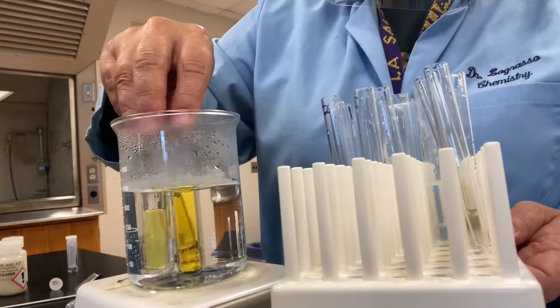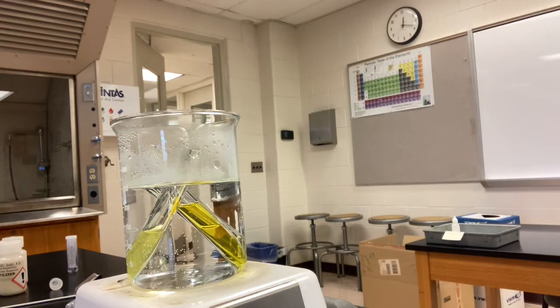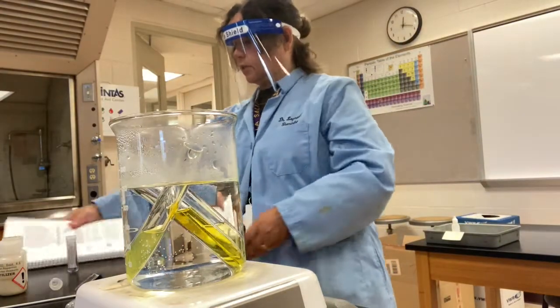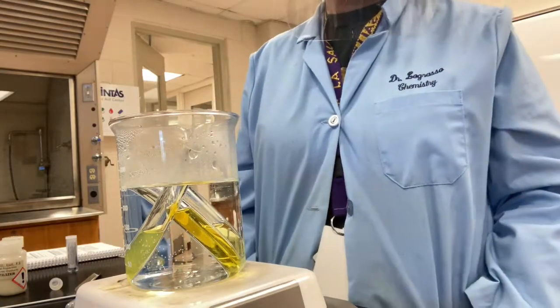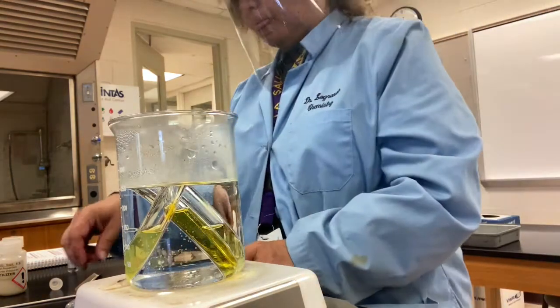and reheat for a few more minutes just to make sure everything's complete. This reaction should produce a yellow precipitate. So we're looking for it to hopefully turn a bit cloudy so that we see that some solid is formed. This thing's a little bit dicey sometimes. Hopefully it's going to work for us today.